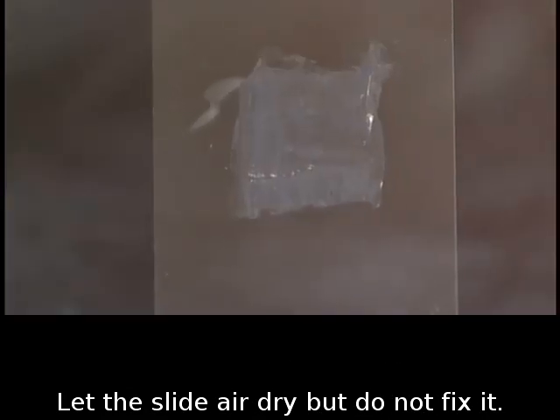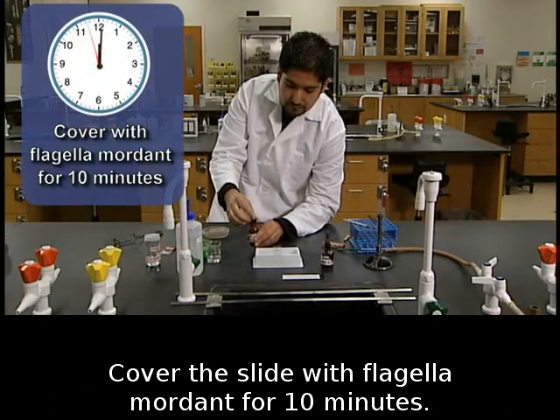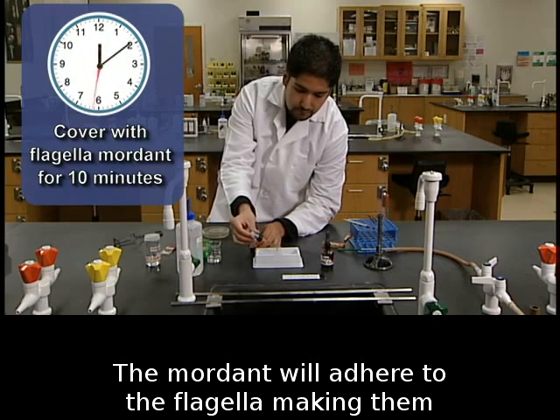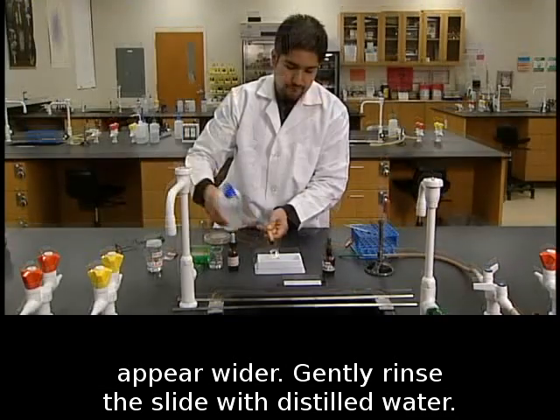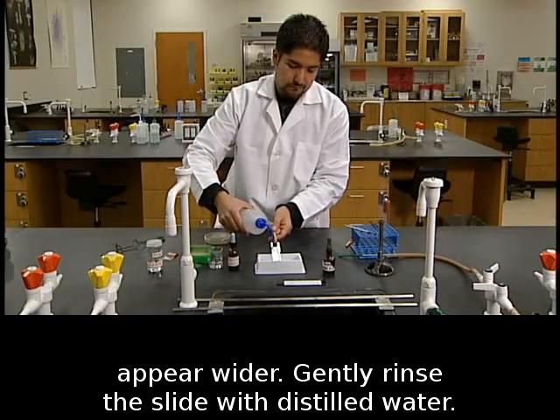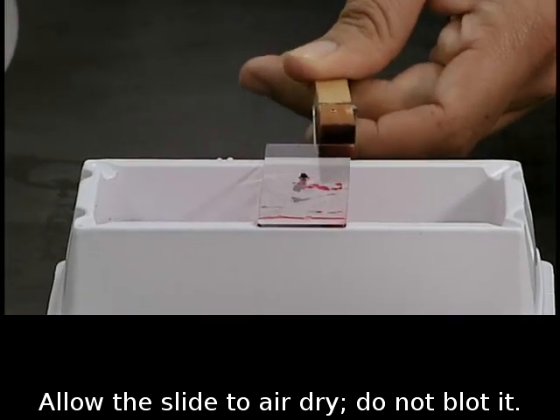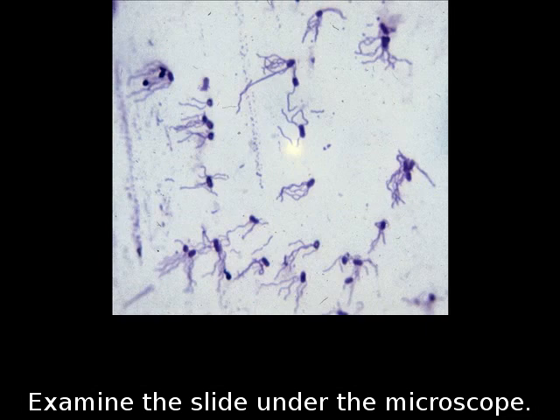Let the slide air dry, but do not fix it. Cover the slide with flagella mordant for 10 minutes. The mordant will adhere to the flagella, making them appear wider. Gently rinse the slide with distilled water. Allow the slide to air dry. Do not blot it. Examine the slide under the microscope.